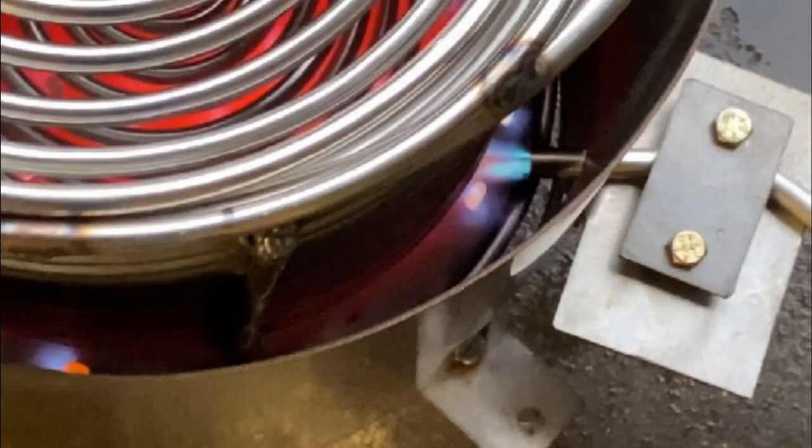Here's a quick clip of the pilot light position. This particular torch is the only one I can get on short notice because the stores, for whatever reason, are out of stock of everything where I'm at. The only thing I don't like about this particular pilot light is that this torch will not let me turn the flame down as low as I would like to, but it works very well nonetheless. You can see where I have the end of the torch positioned just across that preheat line right there, and you can see the two discharge ports for the burner — I have it positioned in between them. That's pretty much the best position for the pilot light.